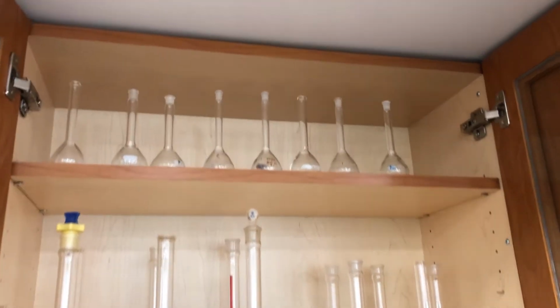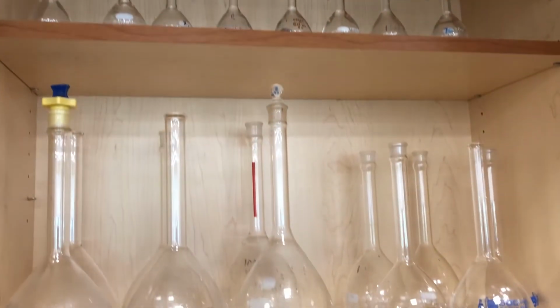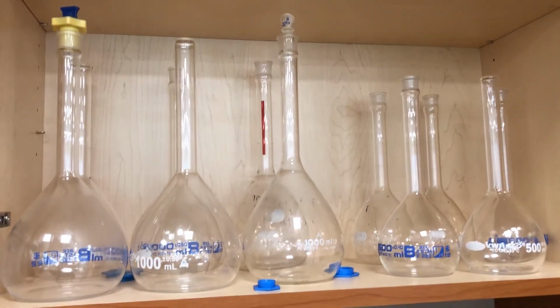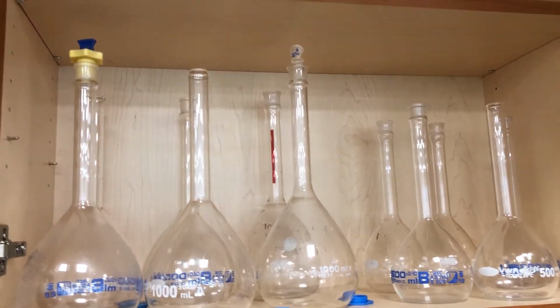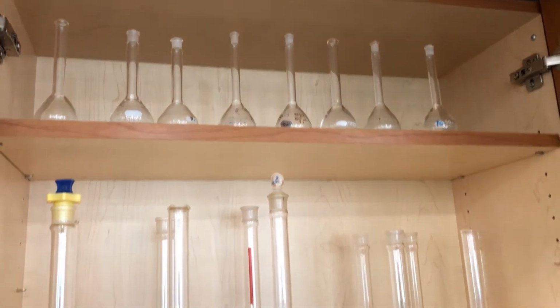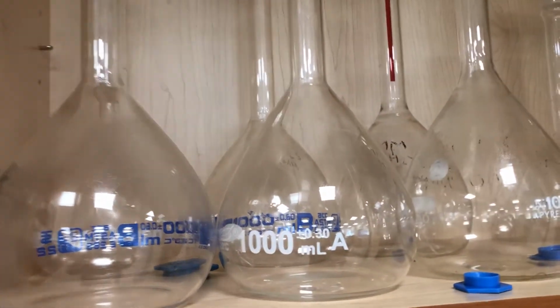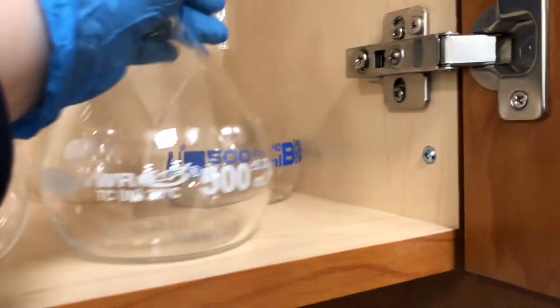To make a diluted solution, you should select the most appropriate volumetric flask and prepare all the solutions you are going to use at once to ensure the accuracy of your data. Making more measurements makes it hard to ensure the concentration of the solution you used is the same, which increases the uncertainty in your calculation. In this case, we are going to use the volumetric flask of 500 cubic centimeters.